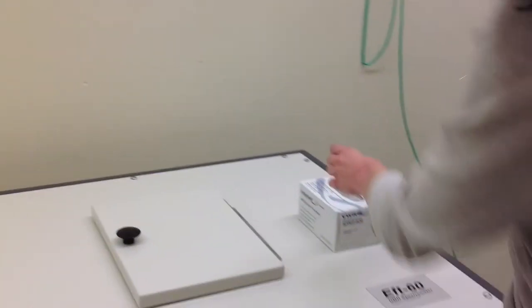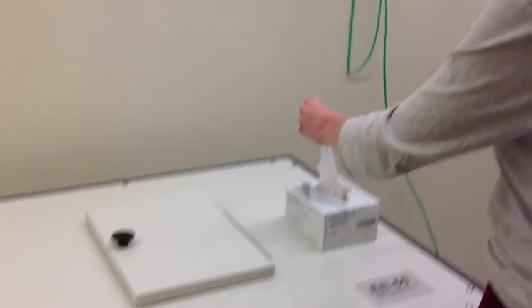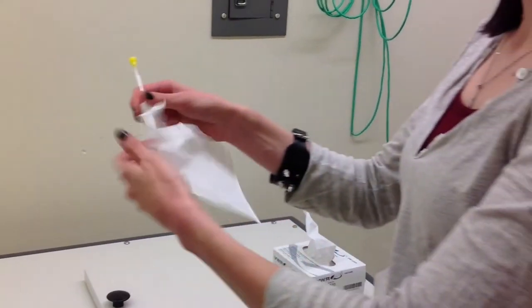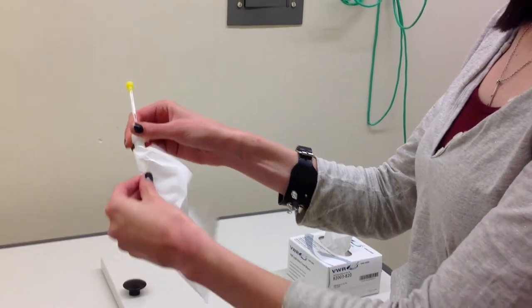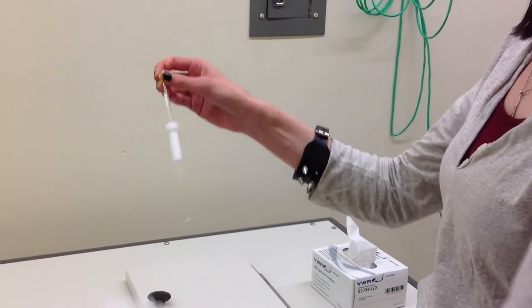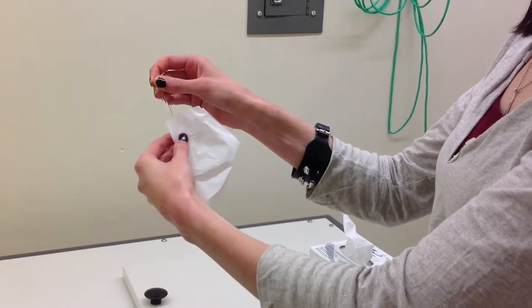Now you have to take a kim wipe and wipe off the tube, a little bit more rough down the glass and more gently on the spinner.